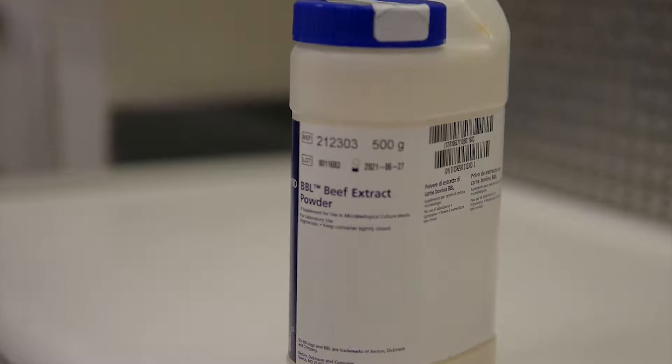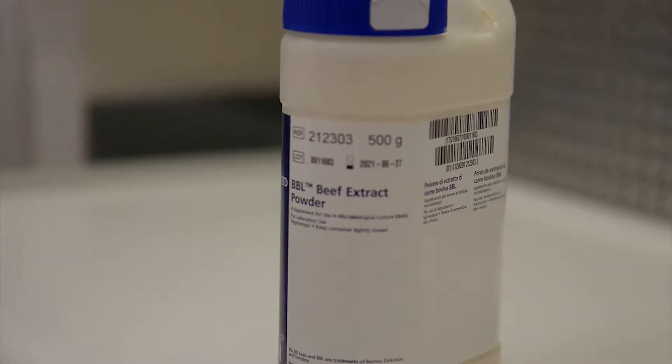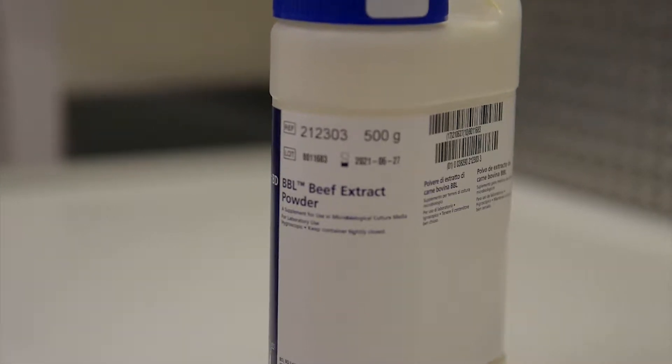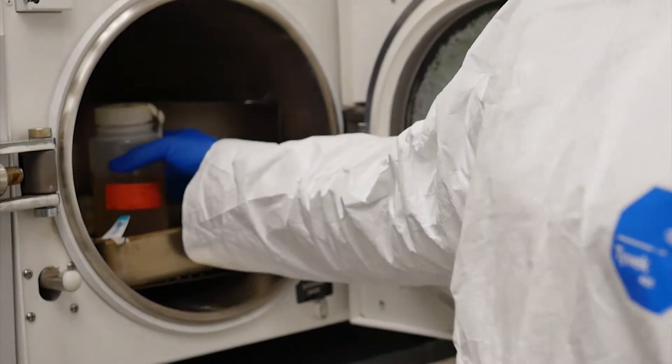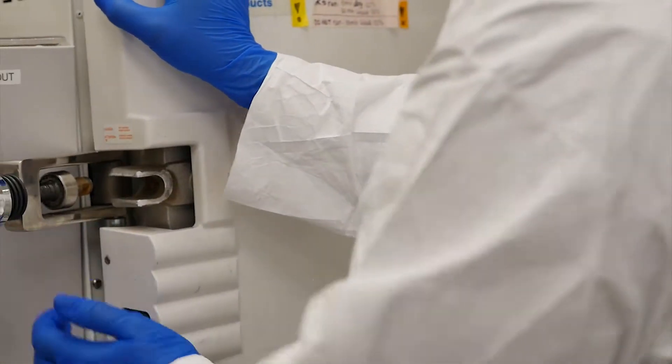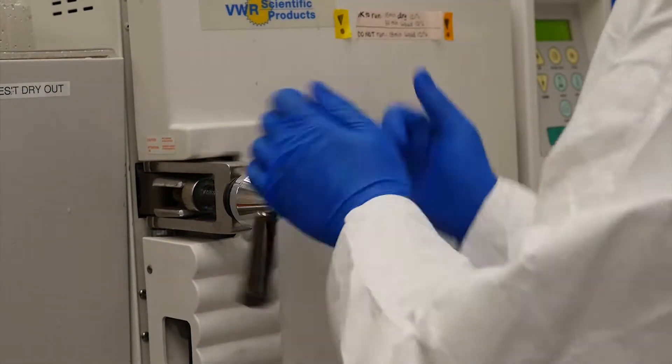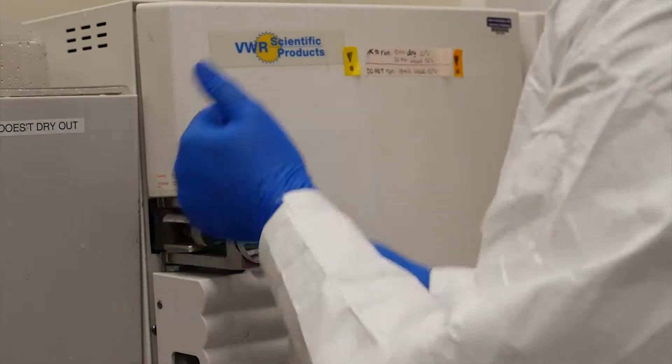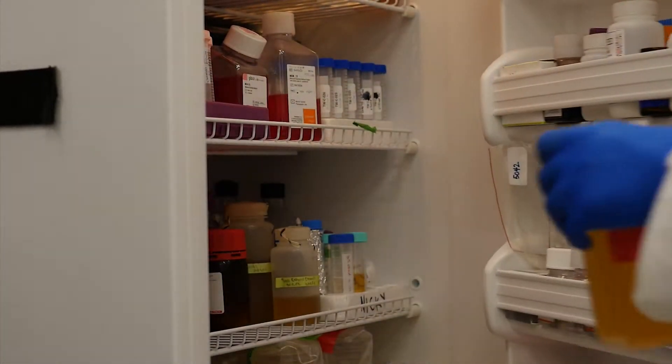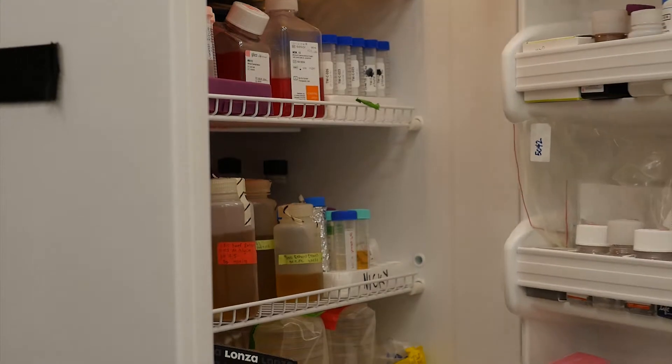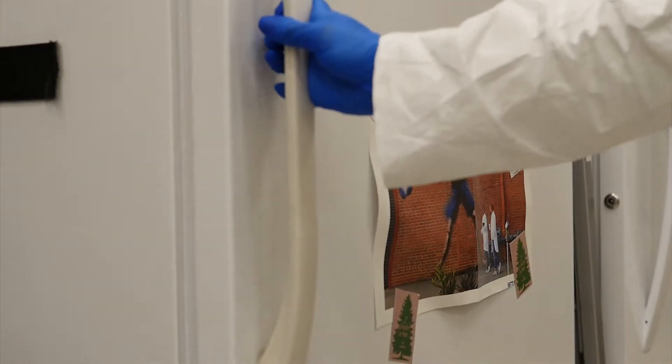BD-BBL beef extract powder is the validated reagent brand for this protocol. Autoclave the freshly prepared beef extract eluent at 121 degrees Celsius. You can store the eluent at 4 degrees Celsius for up to 1 week or at negative 20 degrees Celsius for 3 months.